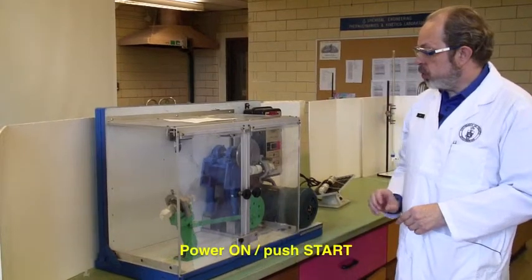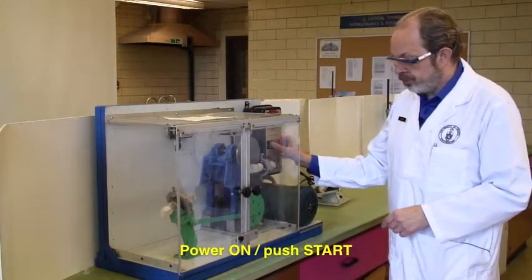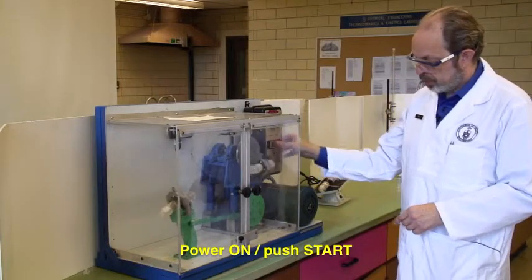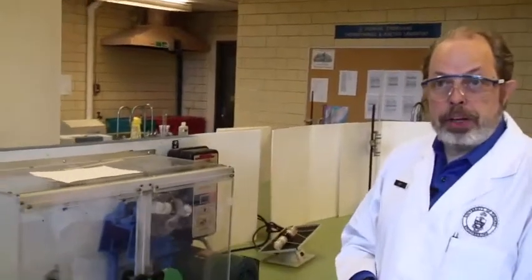Now that we're ready to go, you turn the machine on, and you push the start. And away we go.